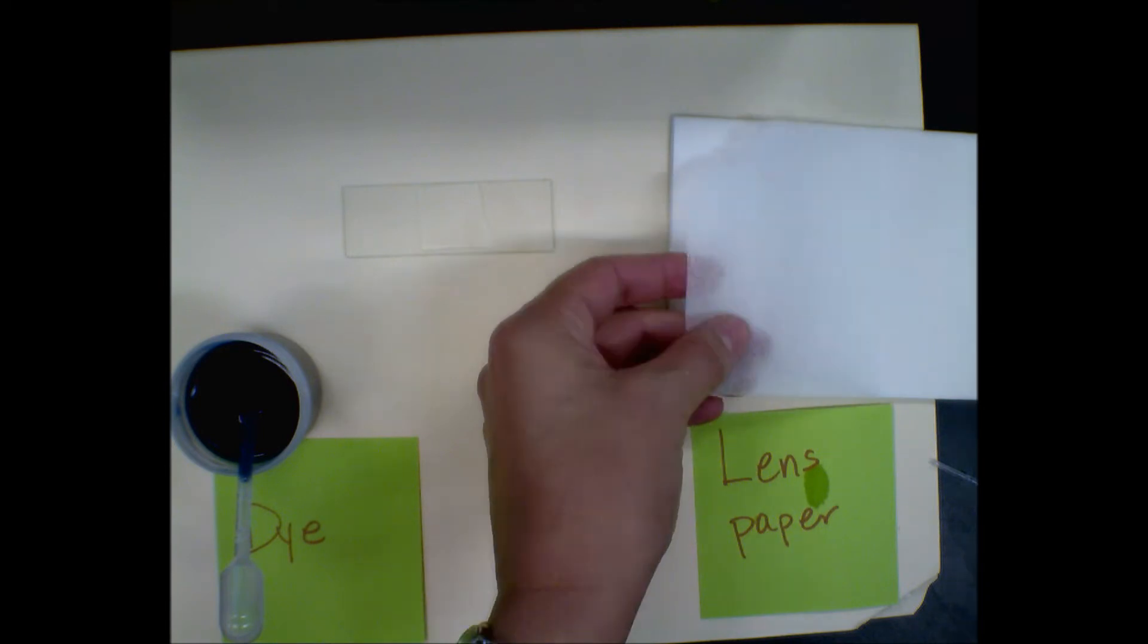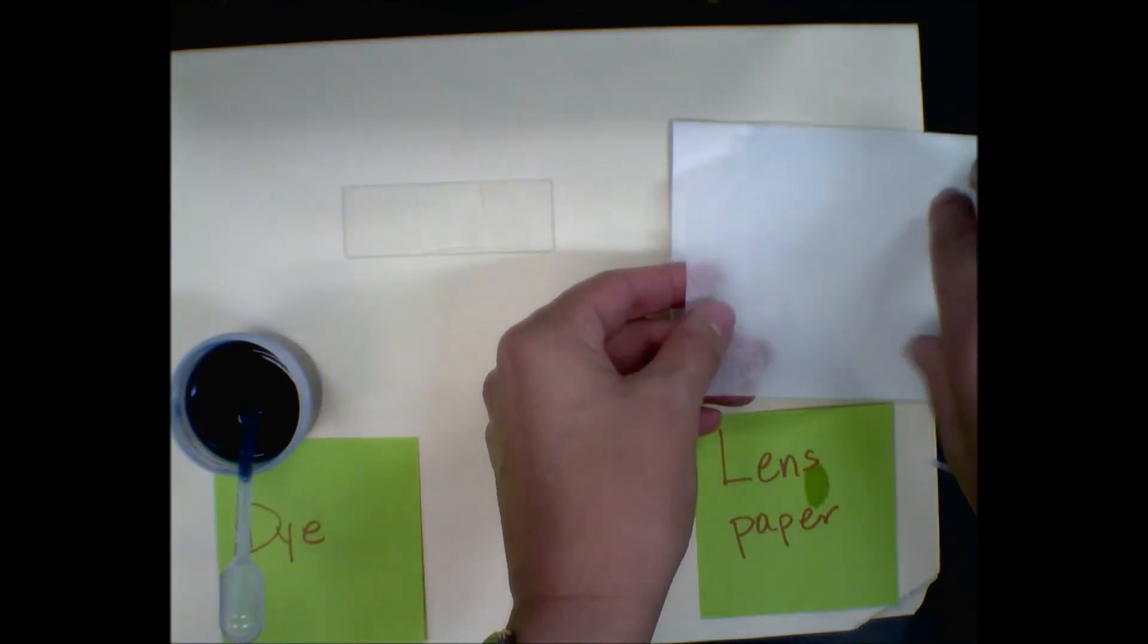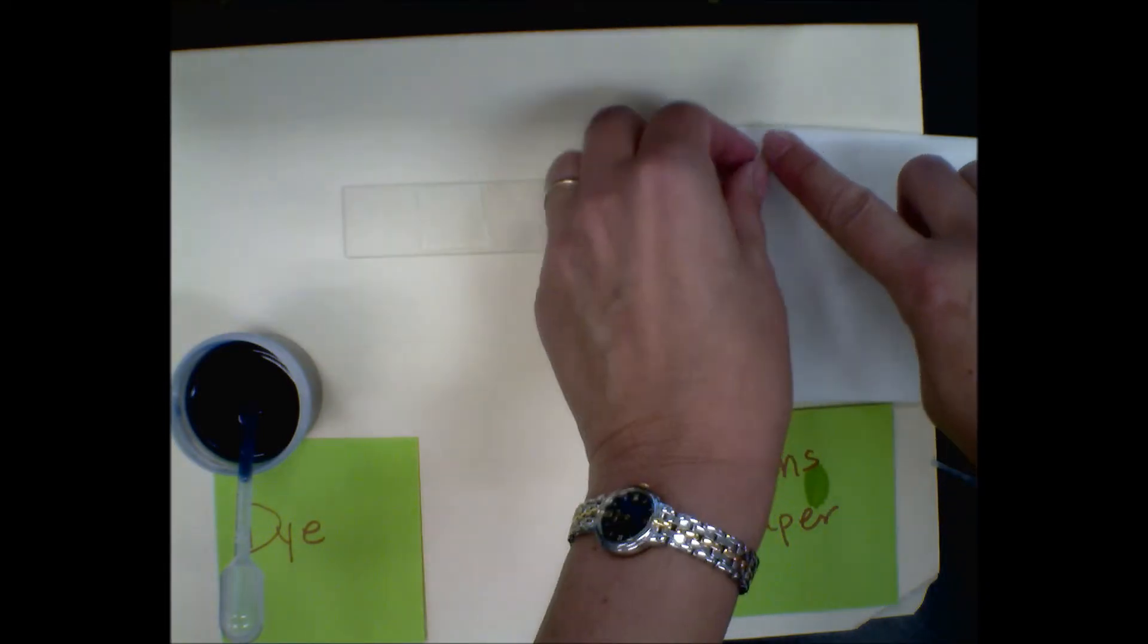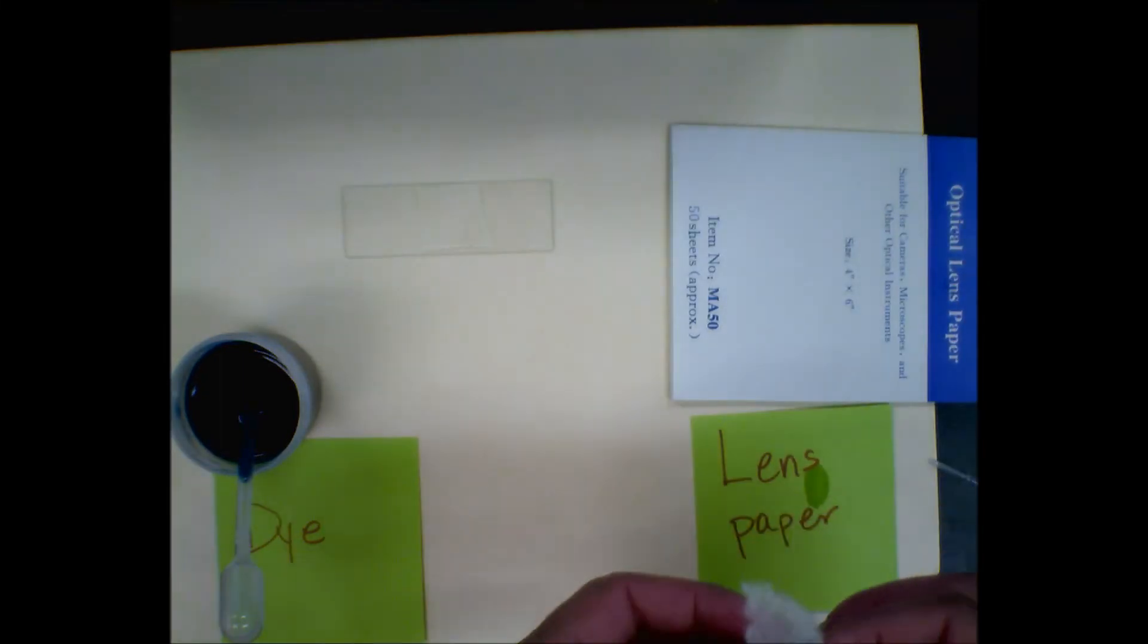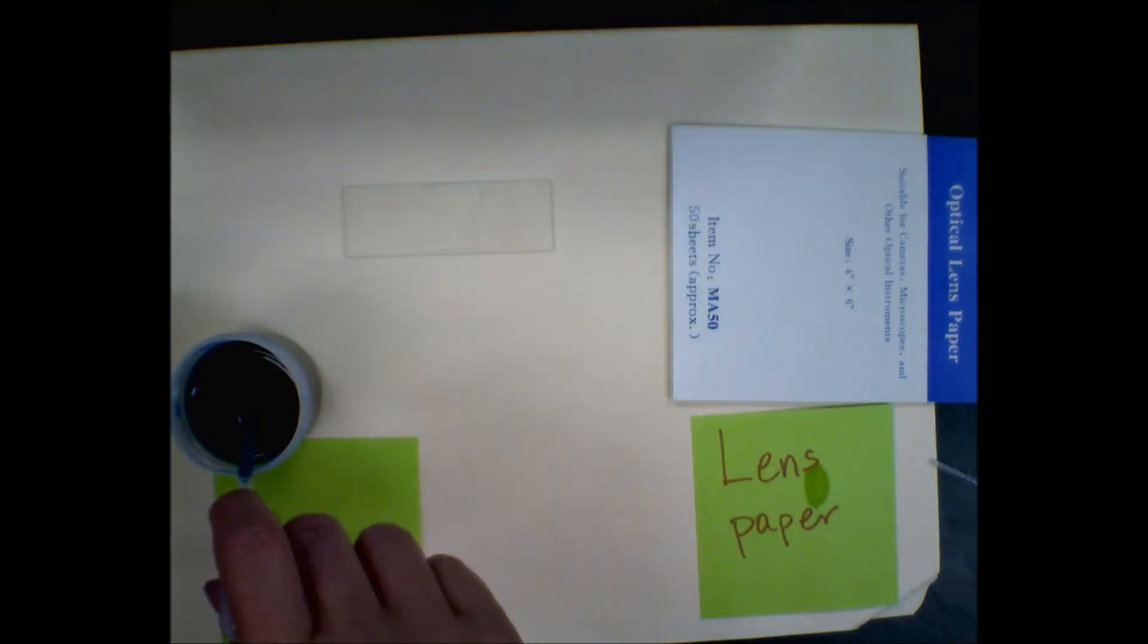I don't need a whole sheet and you can see that previous people have not used the whole sheet because you don't need a whole sheet, so you just tear off a little piece. I realize that disturbs some of you but you have to get over it.